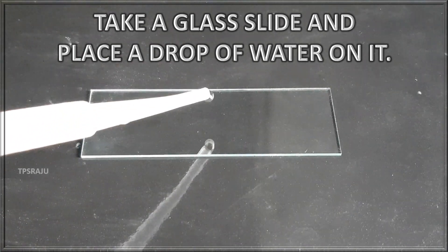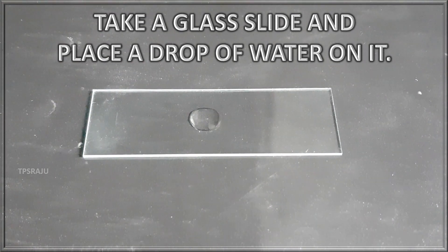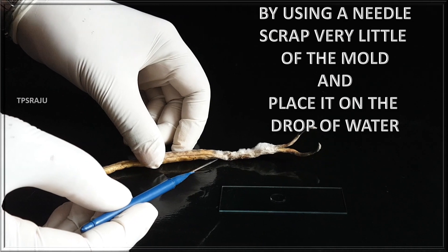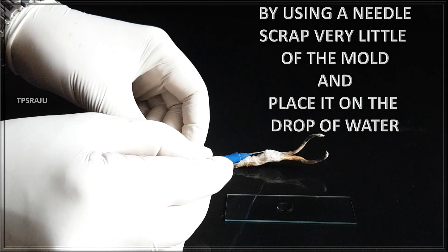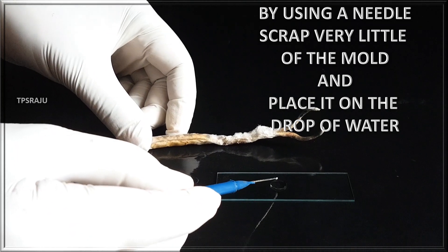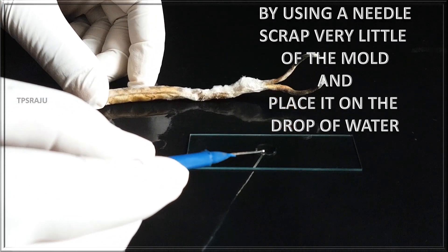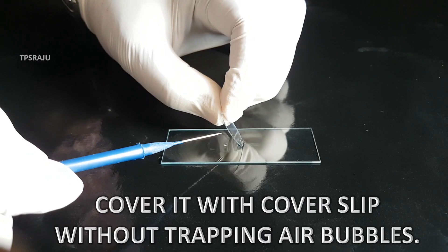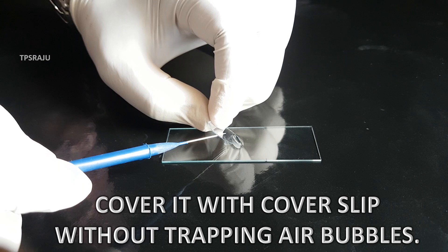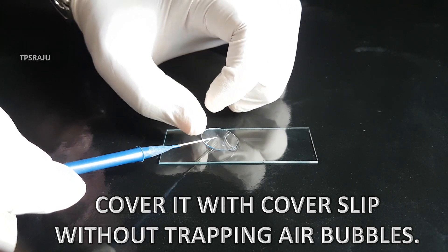Take a glass slide and place a drop of water on it. By using a needle, scrape very little of the mold and place it on the drop of water. Cover it with a coverslip without trapping air bubbles.